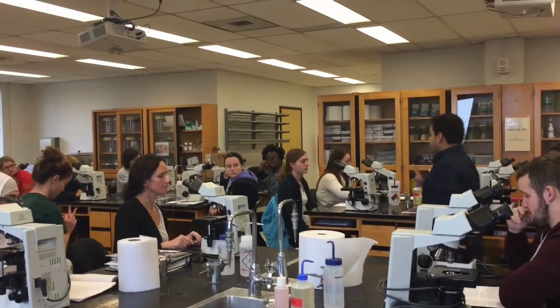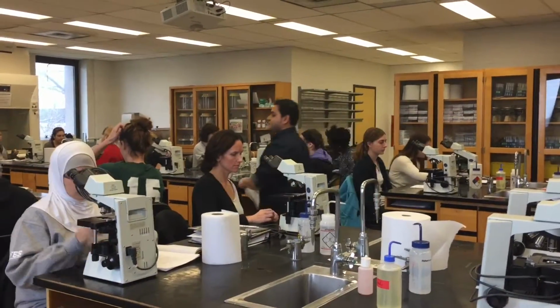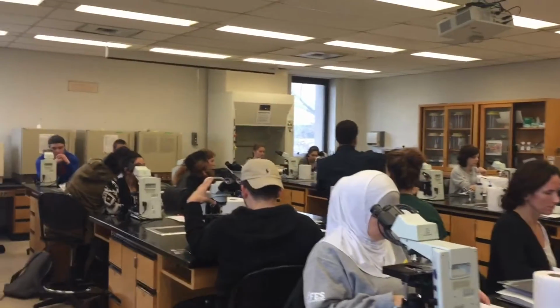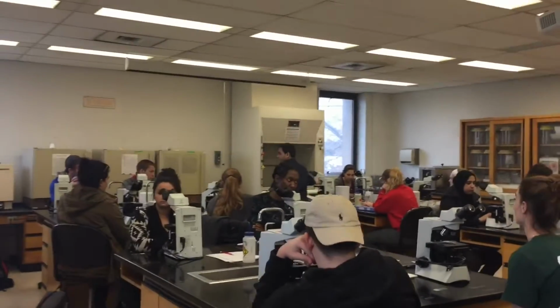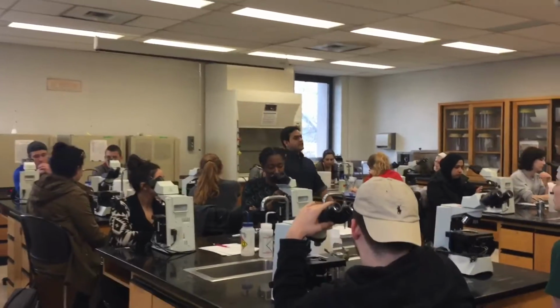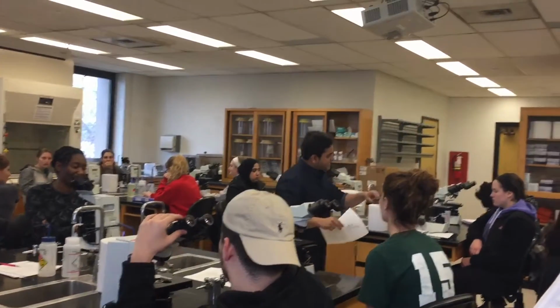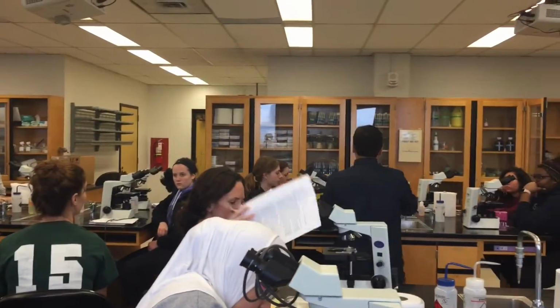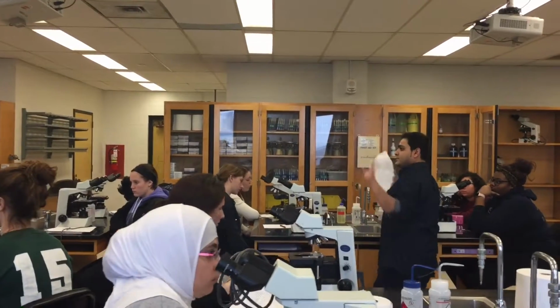First thing is the microscope should be stored at 4x objective magnification, the red one. 4x objective means the top one that you can rotate. This is the objective magnification. So it should be stored at 4x magnification. You'll notice some of them were not stored, so make sure when you put them back, you put it on 4x before you put it in the cabinet. And the wire should be wrapped the way it is wrapped around. Okay, good. So now everyone is on the same page.